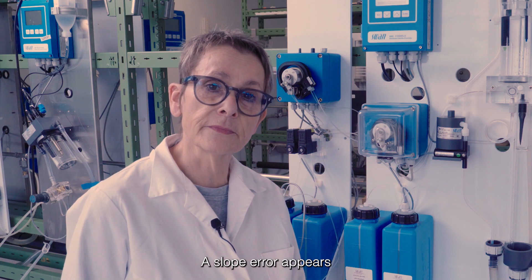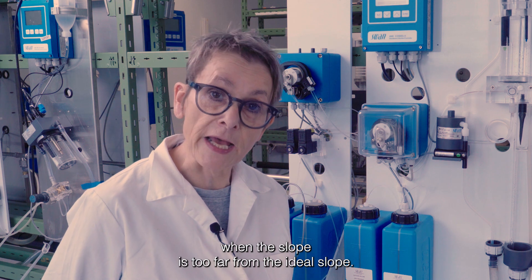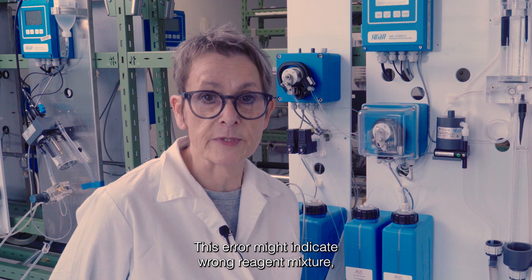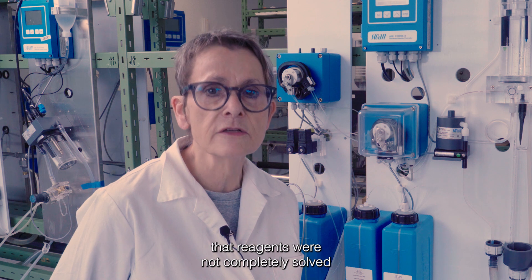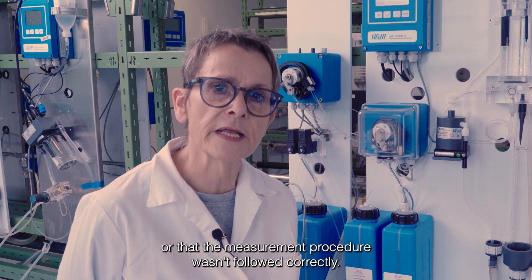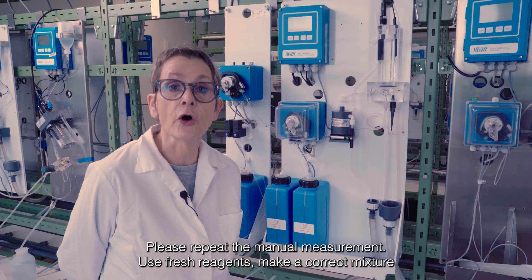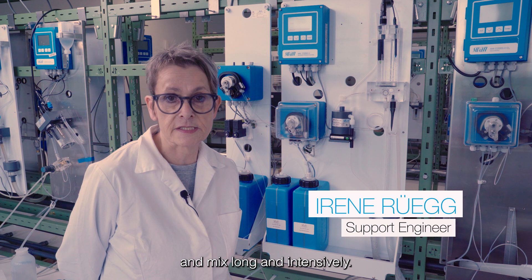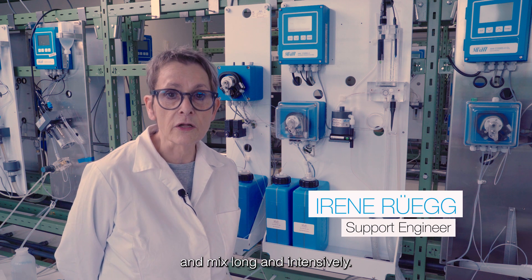Error message: a slope error appears when the slope is too far from the ideal slope. This error might indicate wrong reagent mixture, that reagents were not completely dissolved, or that the measurement procedure wasn't followed correctly. Please repeat the manual measurement, use fresh reagents, make a correct mixture, and mix long and intensively.